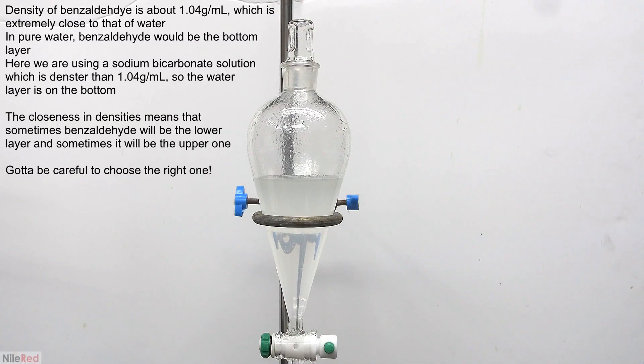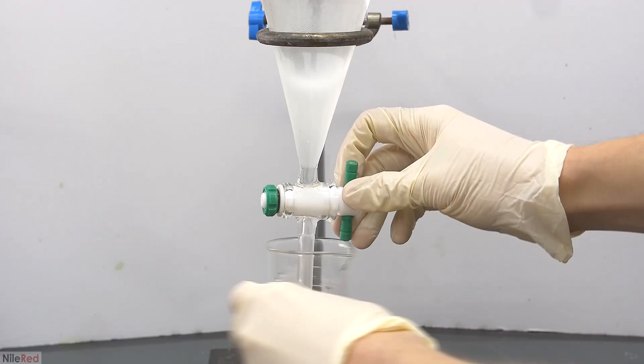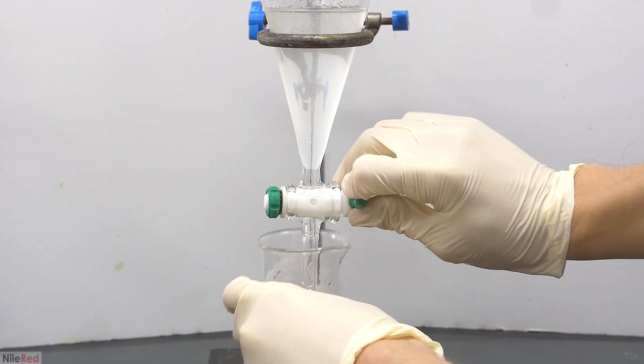After sitting around for a little while, the layers will eventually separate. The separation probably won't be exceptional though, and each layer might remain a little bit cloudy. Into a beaker, I then drain off the lower water layer.